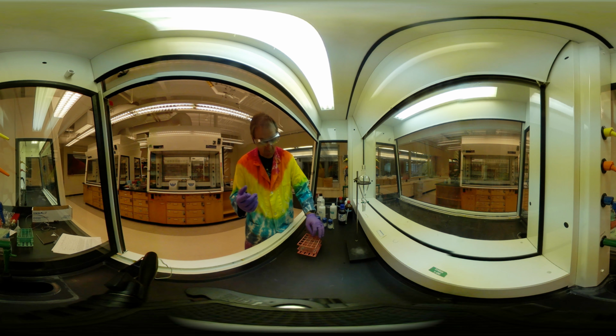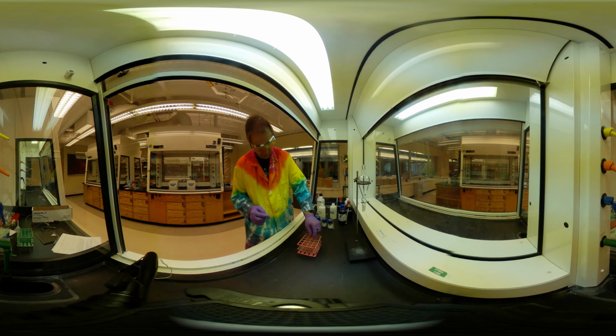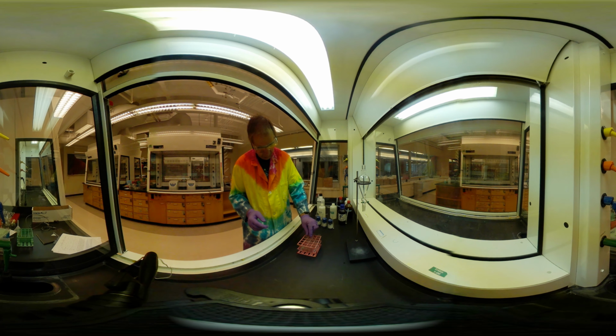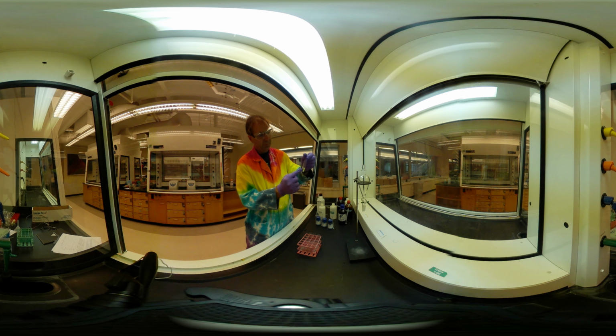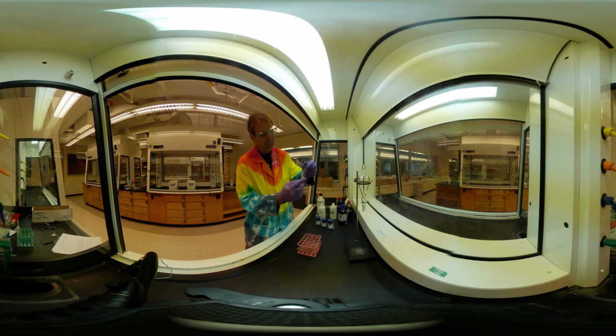Okay, so we'll come back and we'll run through all of these, make sure that you have the data you need. All right, we're halfway there. Mix, mix, mix.